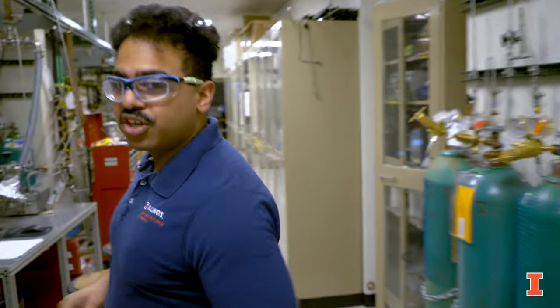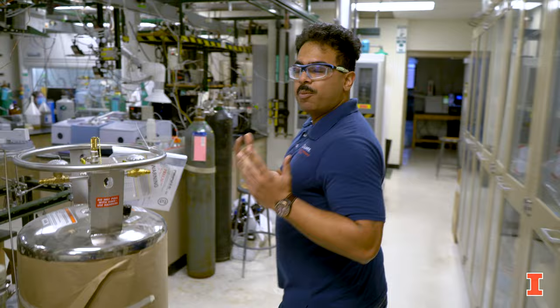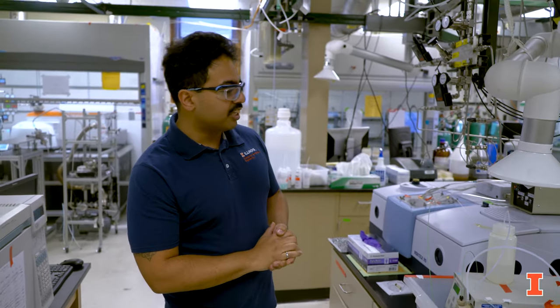Now that you see what our lab looks like, let's take a look at one of the experiments I actually happen to be running right now. At the moment, I'm trying to explore how the solvent structure changes as I flow a solvent over a catalyst. This will help us inform some of our explanations of our reaction kinetics measurements that we make on analogous materials.